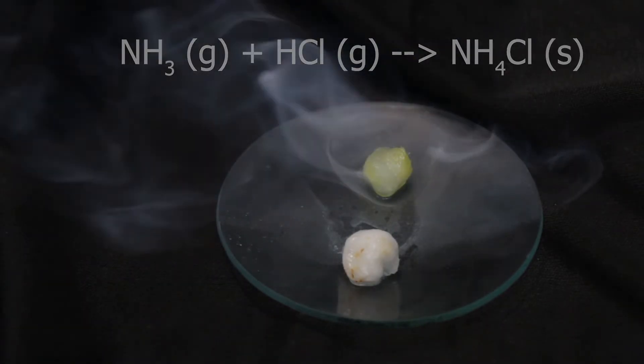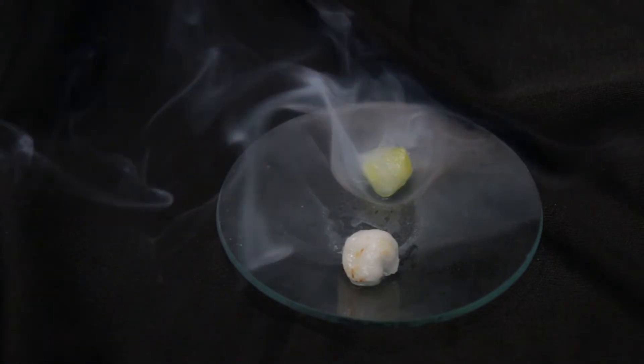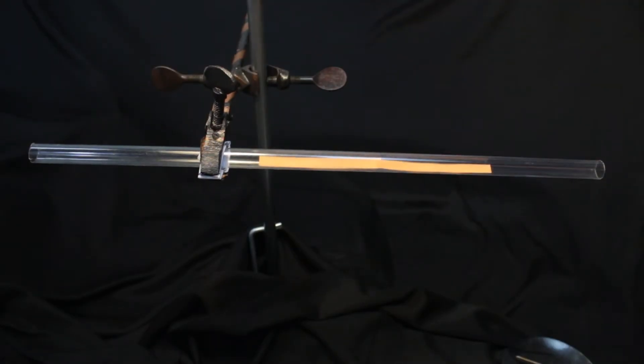Now we are going to look at how particles of these gases are really moving. We will try to track this motion using a tube, and I'm using pH paper.